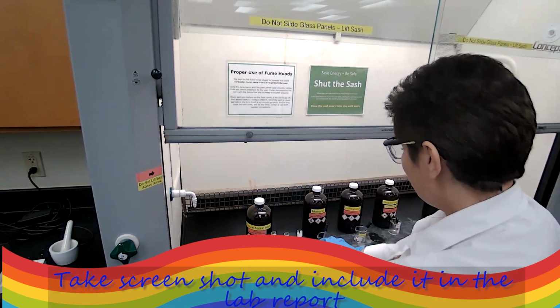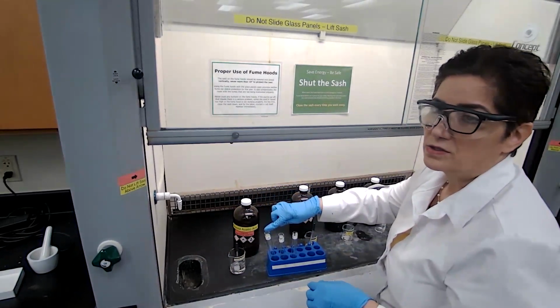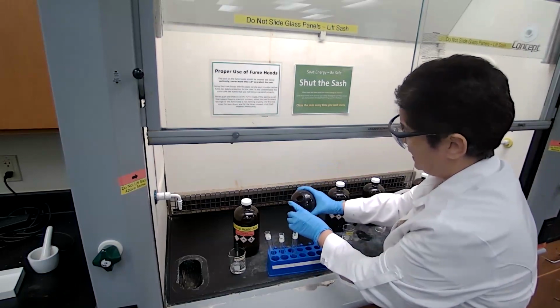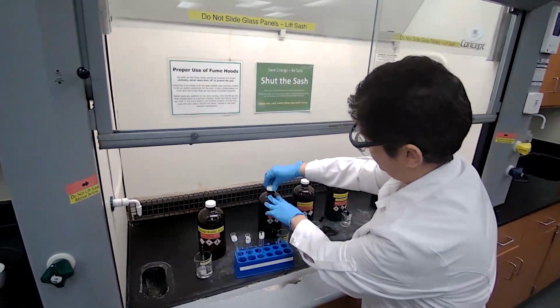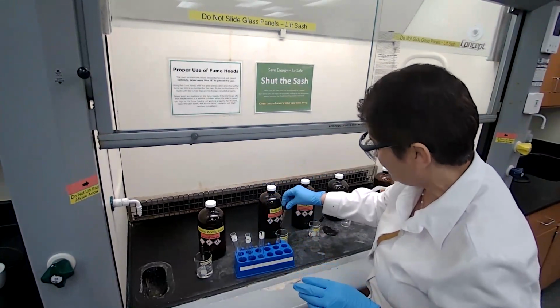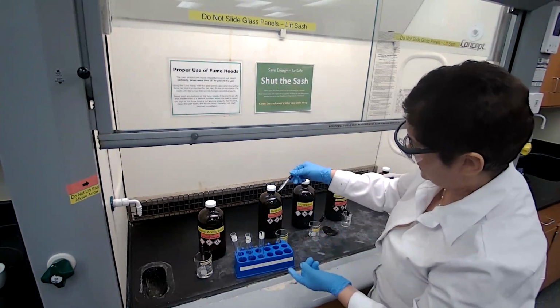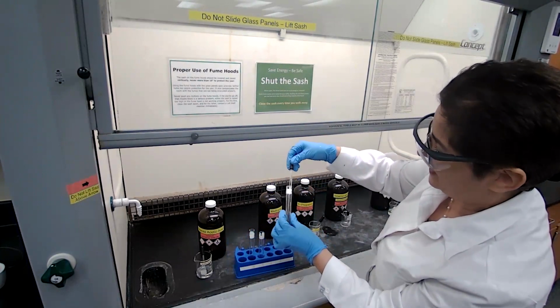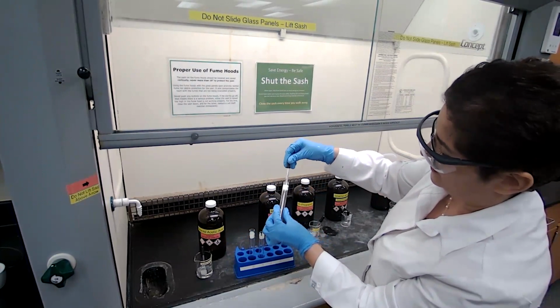Now we add the alcohol. We're adding methanol to the first one. For ester A, adding 20 drops of methanol. 20 drops is about 1 milliliter. If I just take 1 full dropper, that kind of satisfies the 20 drops. But for the purpose of this experiment, I'm just going to count it. 1, 2, 3, 4, 5.